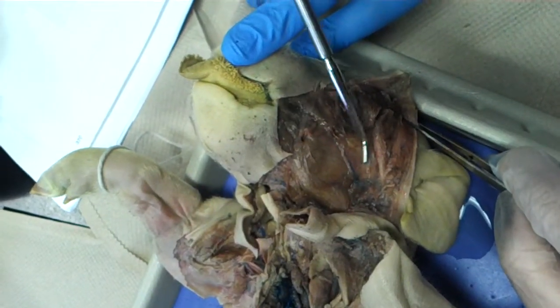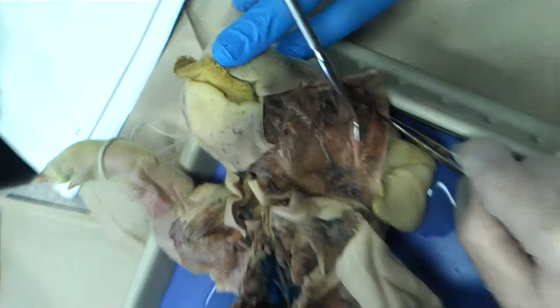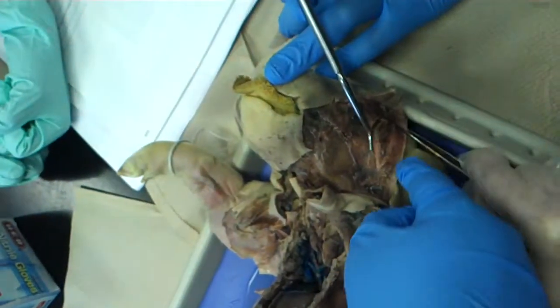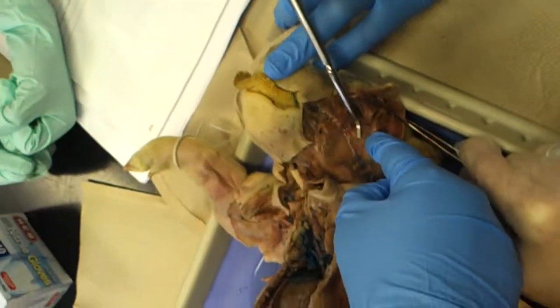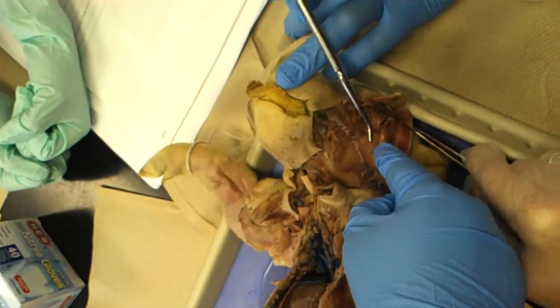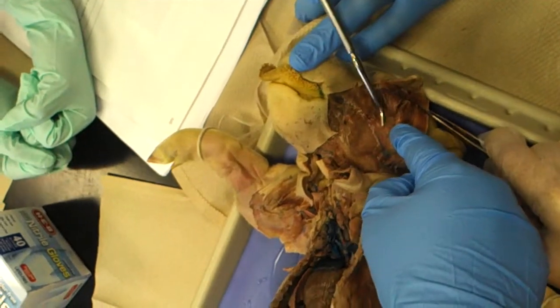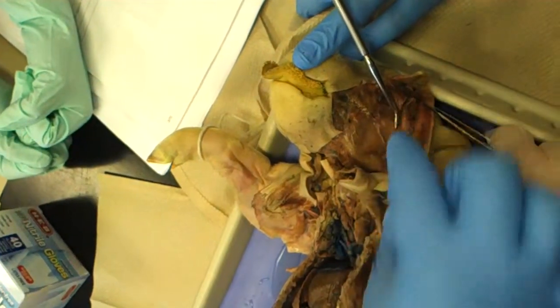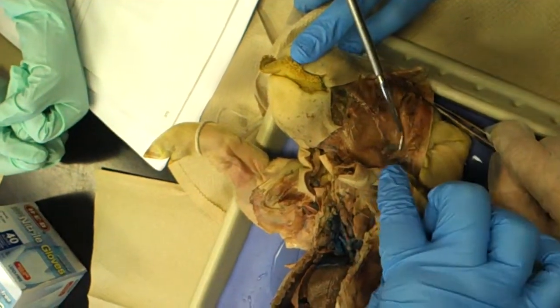Okay. Because like the top part of it, closest to the ear, so like up here would be the parotid — how do y'all say that word? Parotid. And then there should be like this little bitty thingy.